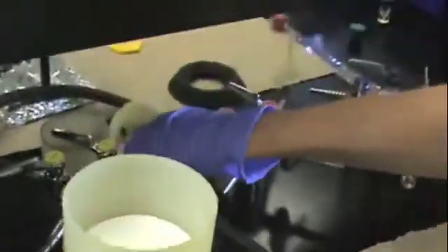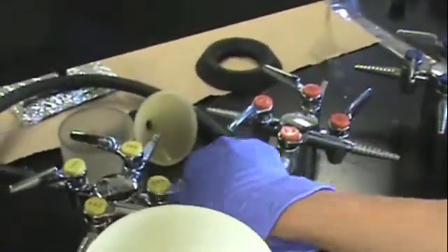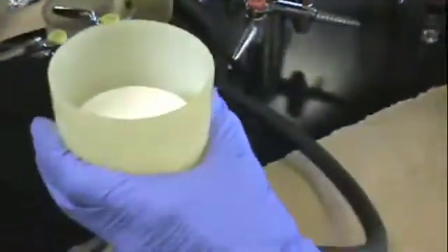Turn on the vacuum line using the switch. You should test for vacuum using your hand.